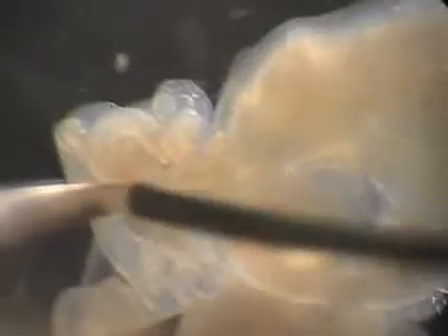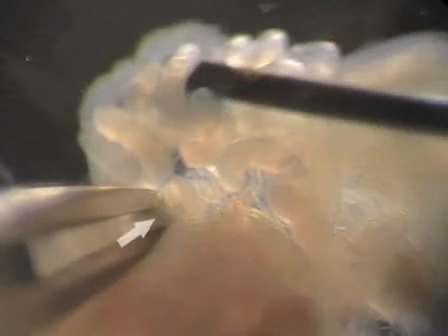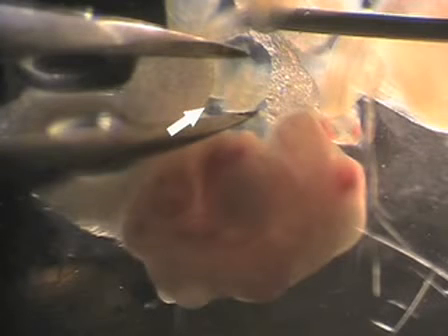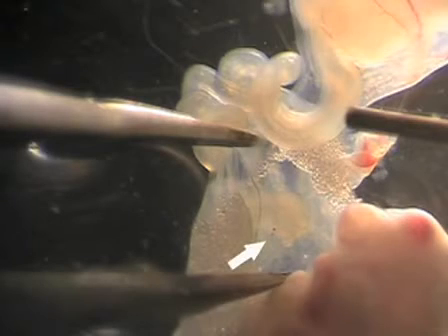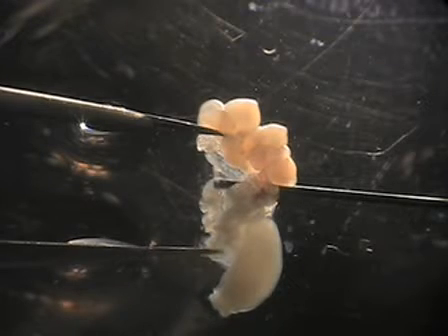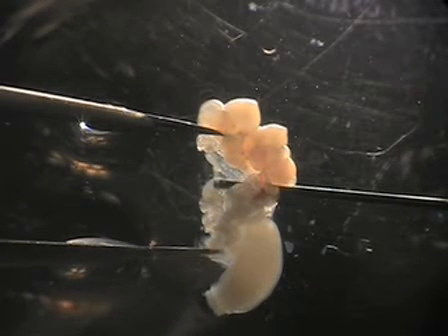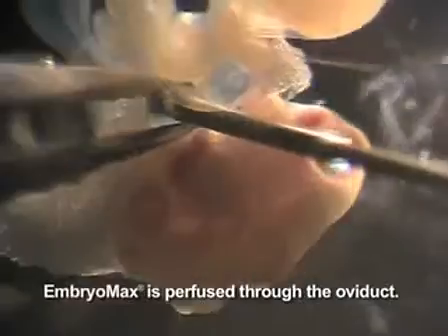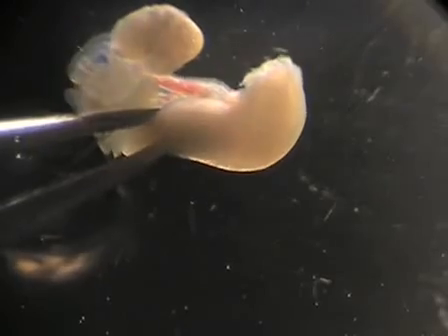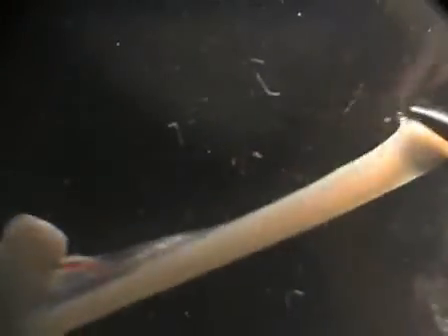The infundibula is a trumpet-shaped structure, isolated here. The tip of my needle is in the infundibula, which was pointing through the layer of tissue. To ensure that I've isolated all of the embryos and eggs, I like to squeeze like a tube of toothpaste on the uterus.